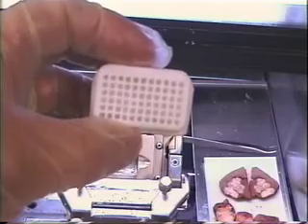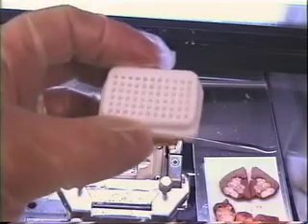Tissues can be either frozen or fresh samples. Either way, the derm needle will punch and insert the tissue into the array mold. For this demo, I am using frozen liver tumor. You are now ready to insert tissues into the array. Keep tissue thickness to approximately one centimeter.